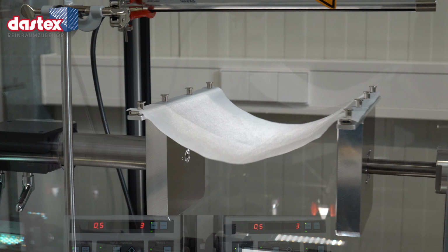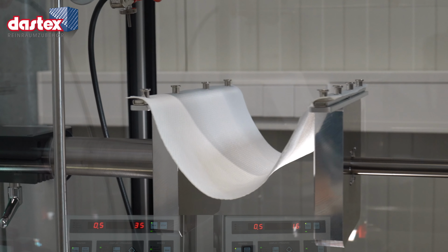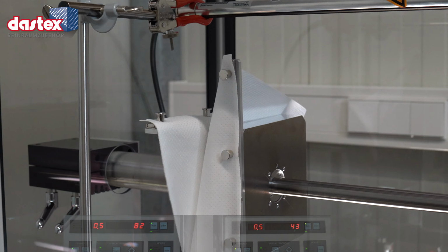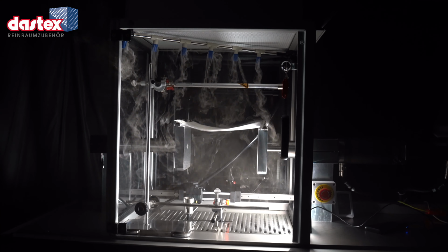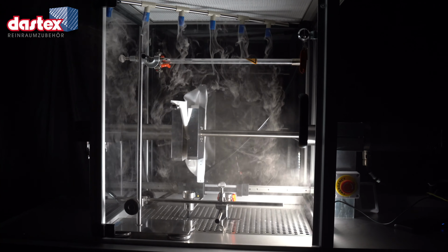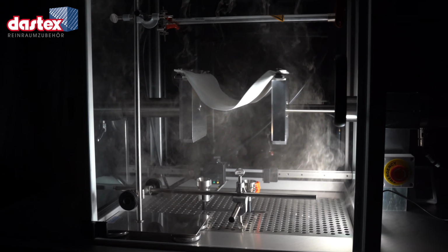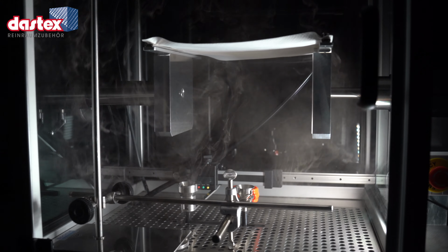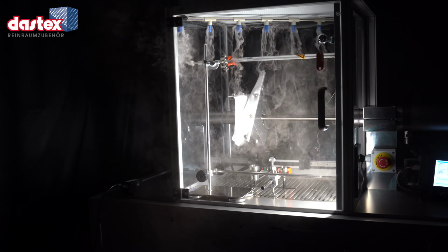In the course of the first series of tests, it became apparent that 2 separate measuring points indicate possible differences between different wipes more than using only one point, and also simplified the interpretation of the measured values. The airflow visualizations carried out several times in advance showed very well that no significant turbulence or dead spots impacted the measuring points and their isokinetic probes. Furthermore, the flow images also showed that the FFU installed above the measuring device ensures a continuous airflow from top to bottom towards the measuring points throughout testing.